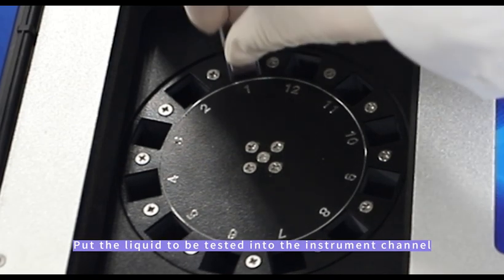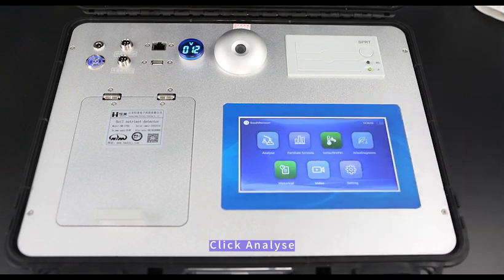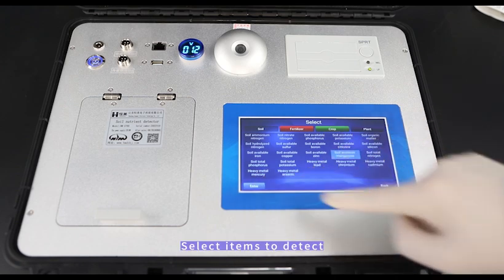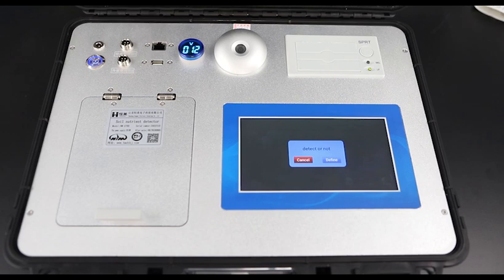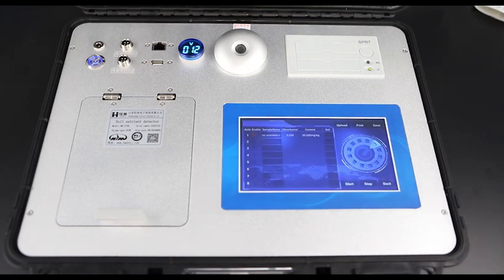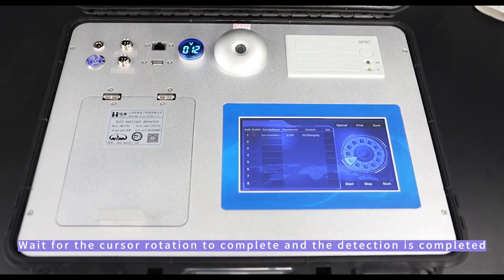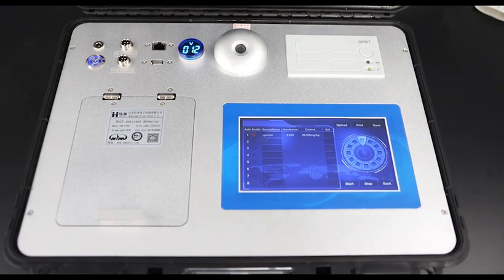Put the liquid to be tested into the instrument channel and click Analyze. Select the items to detect and click to start. Read the test results. Wait for the cursor rotation to complete — detection is finished.